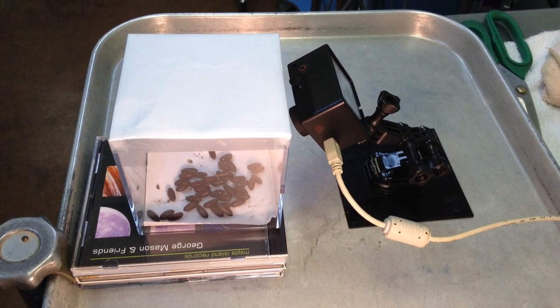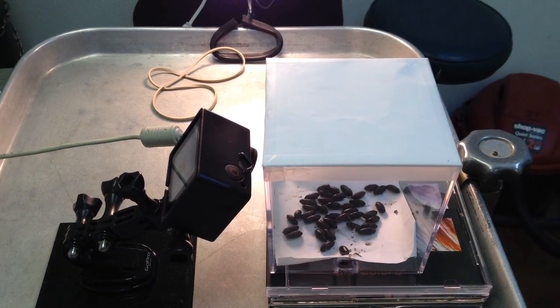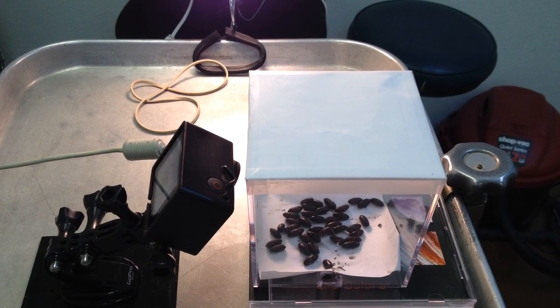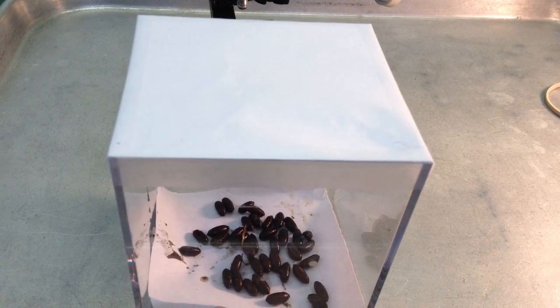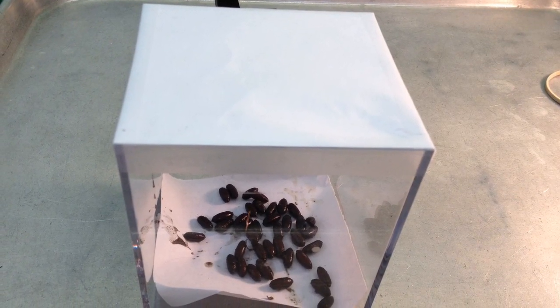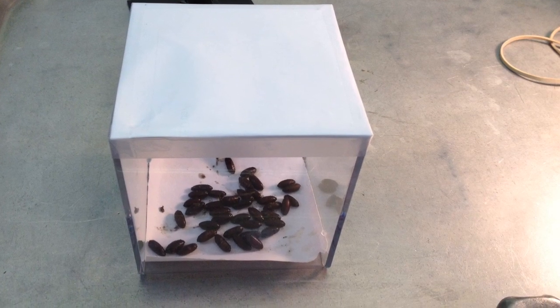Approximately two weeks ago, I had removed some maggot larvae from a Terrapene carolina's leg in two places. I sent that client home with the maggots themselves, trying to feed them. He actually fed them some tube steak, and it kept them alive.